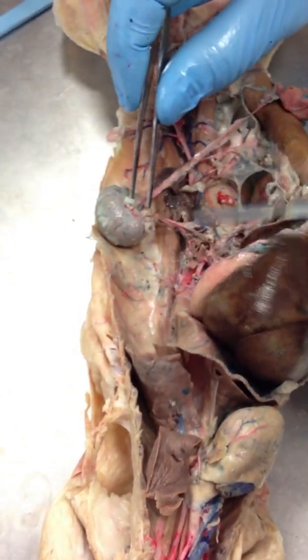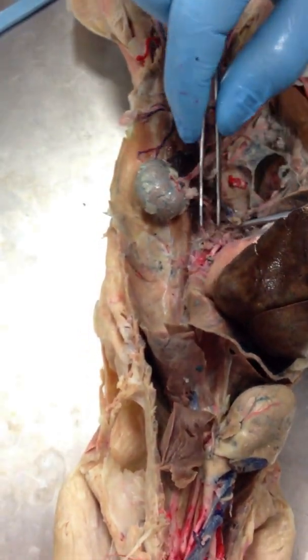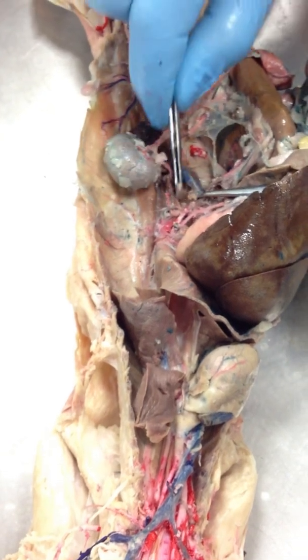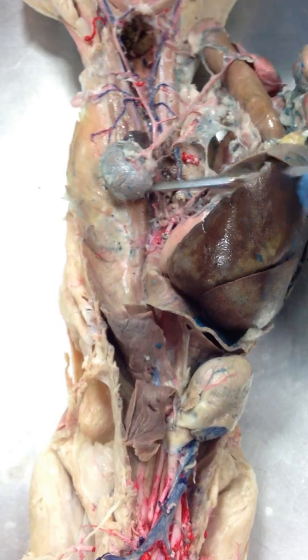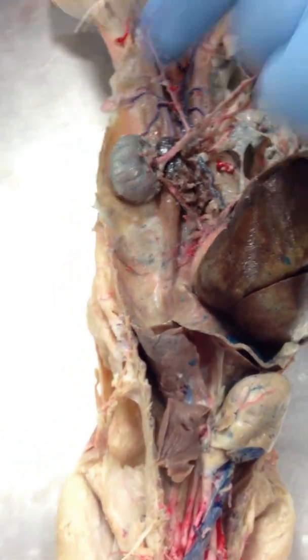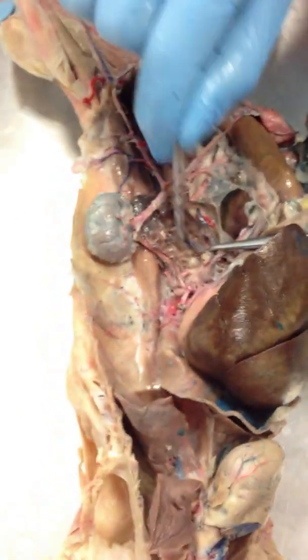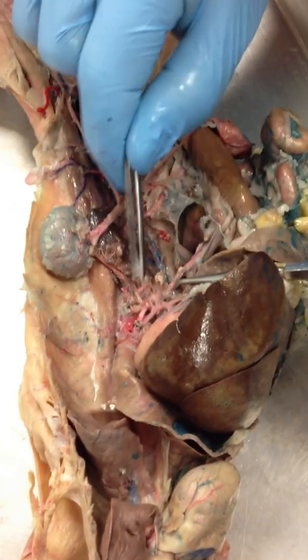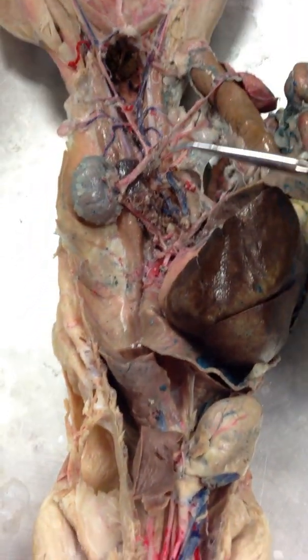The descending abdominal aorta branches into the renal artery and vein. Here's our renal artery going to the kidney — this is our kidney. We've also got the adrenal lumbar artery and vein in here, though they're not too clear on this cat.